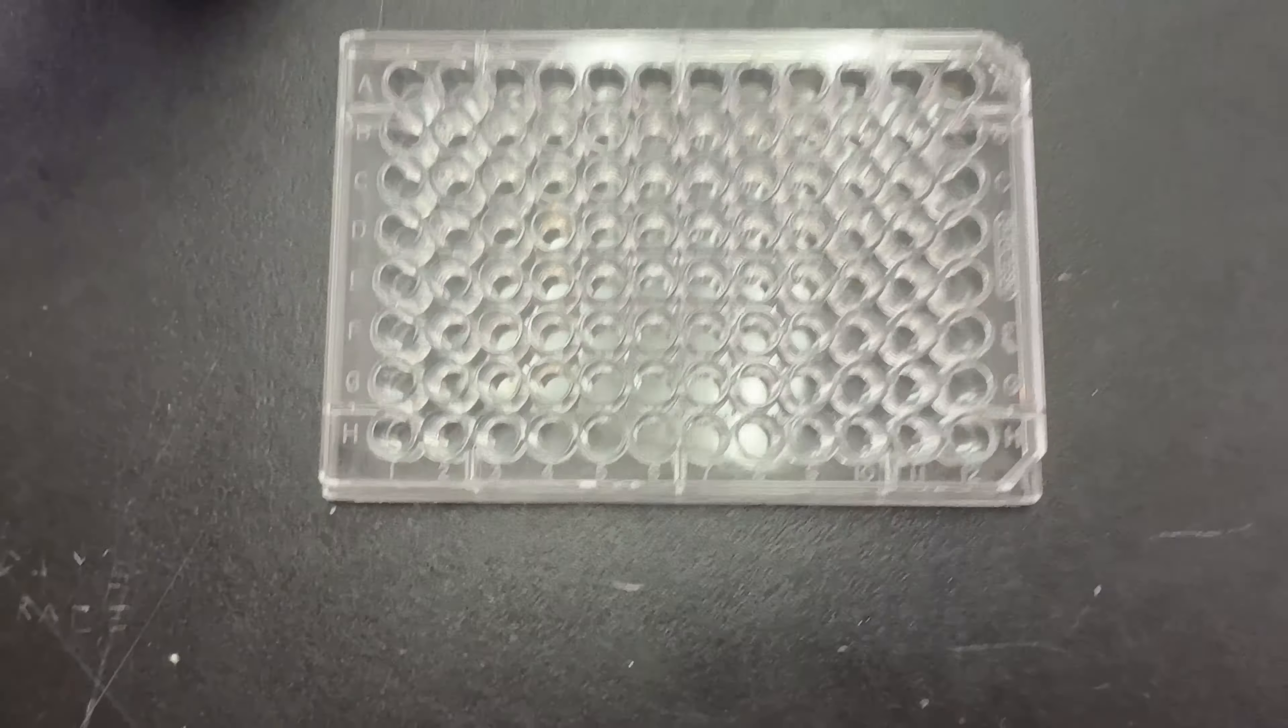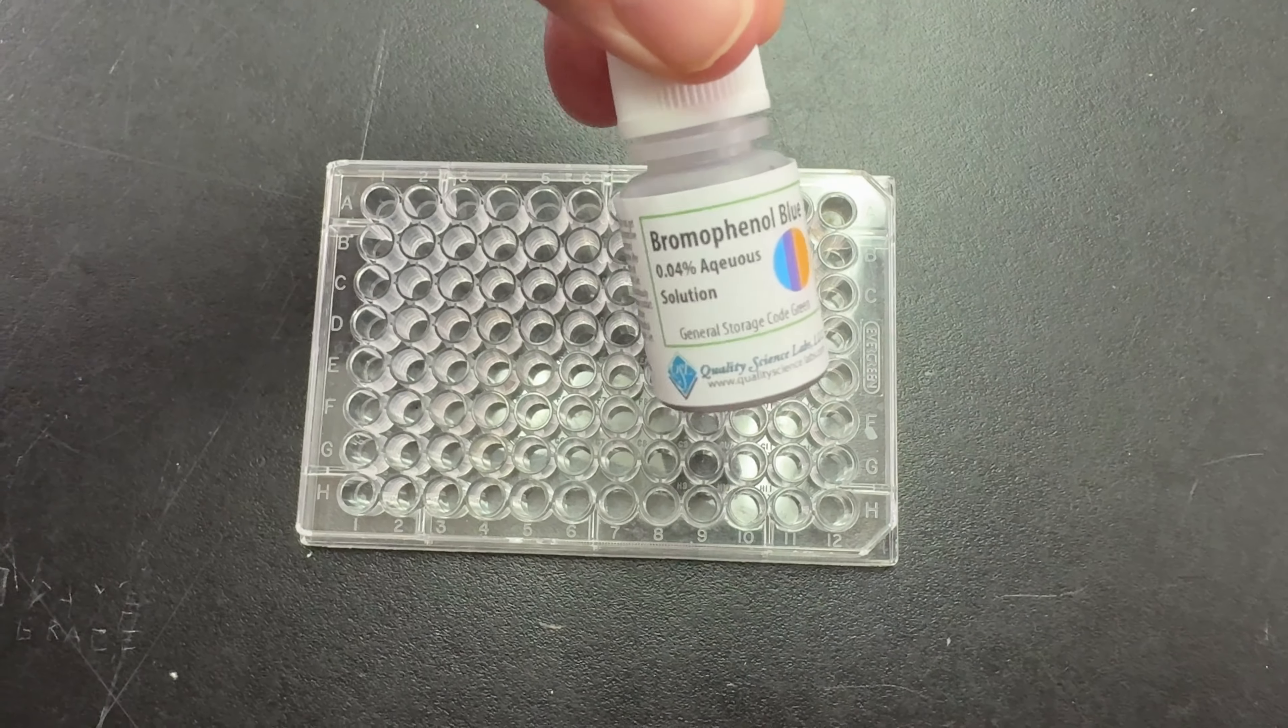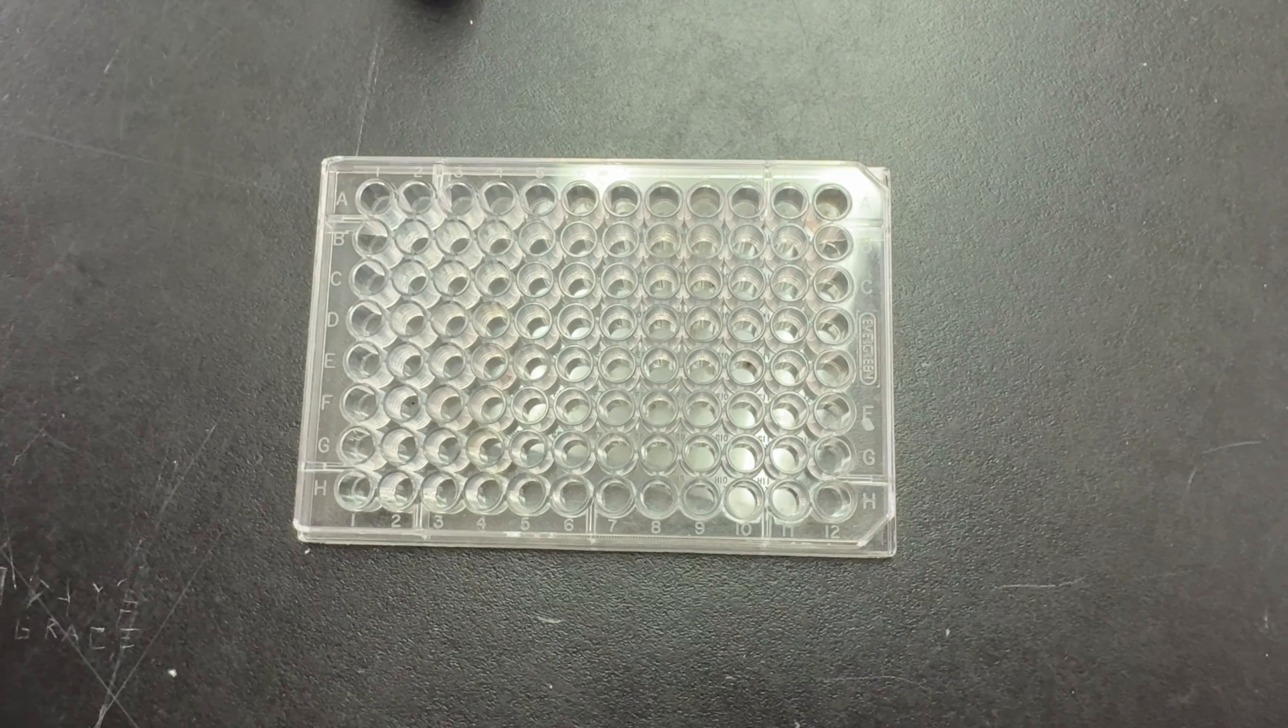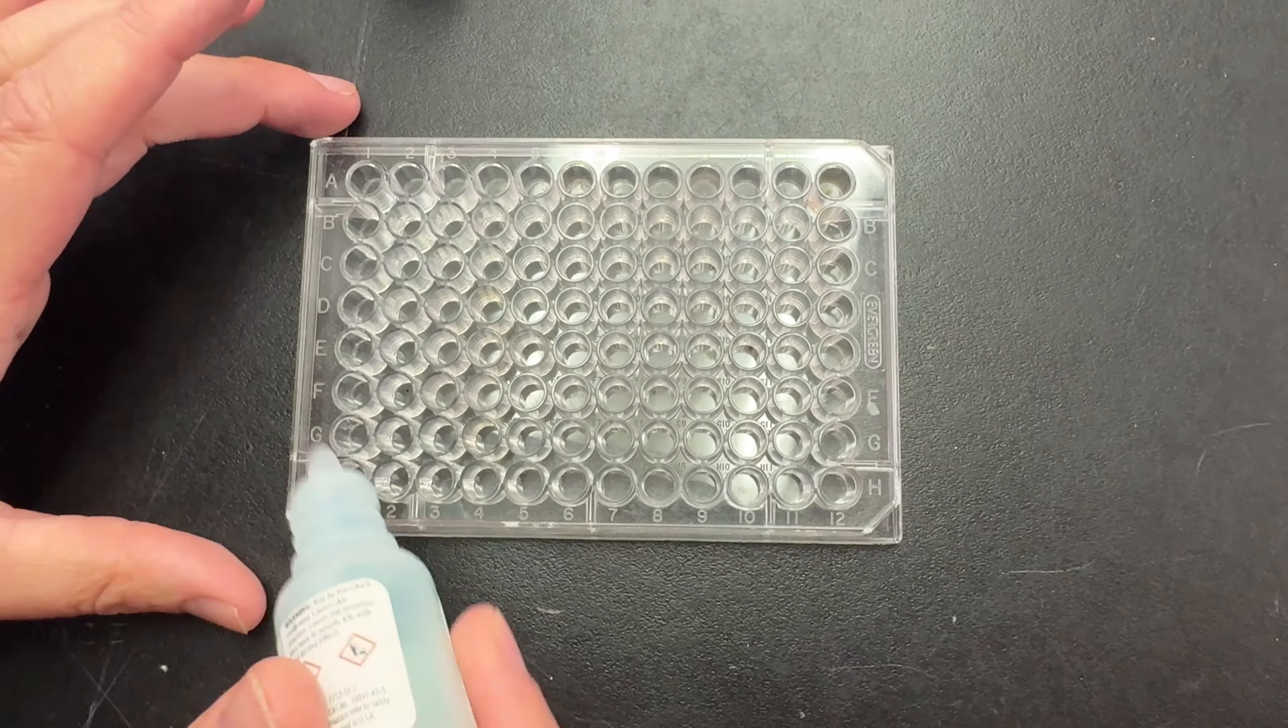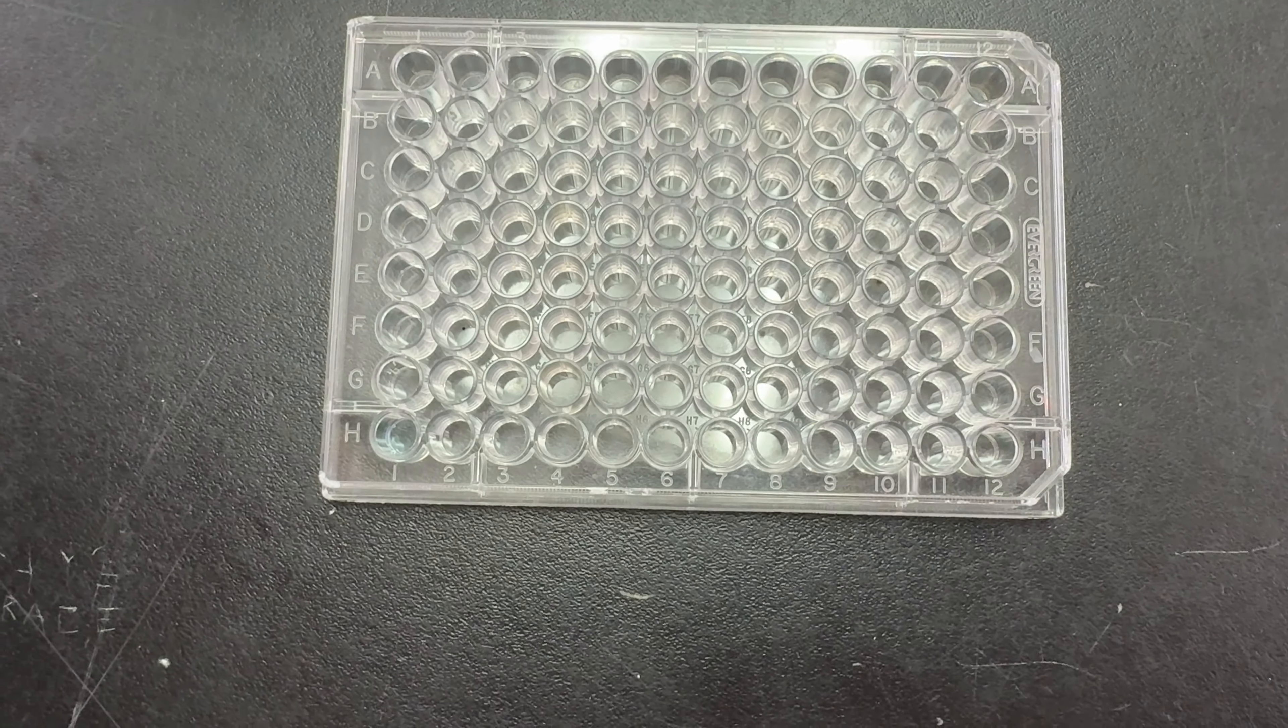Step two: put three drops of copper nitrate and three drops of bromophenol blue into well H1 of the 96-well reaction plate and mix the solution with a mini pipette.